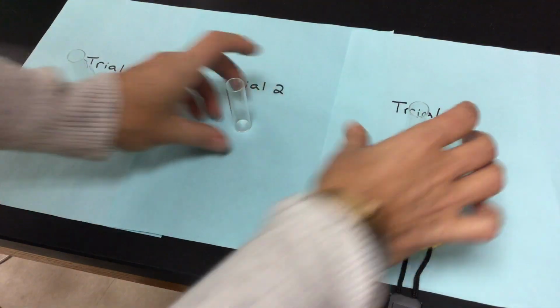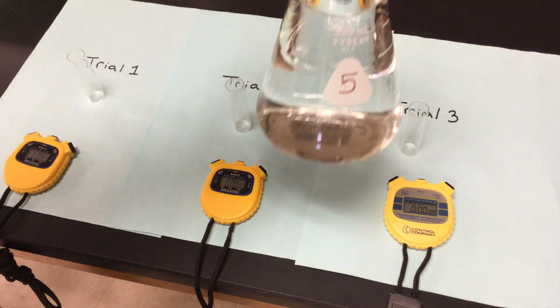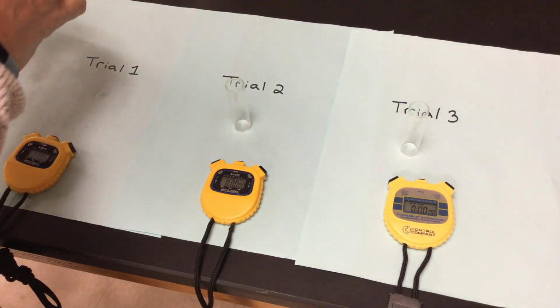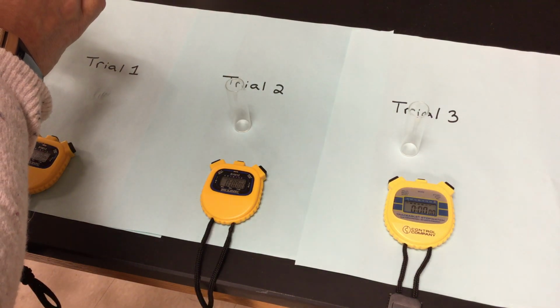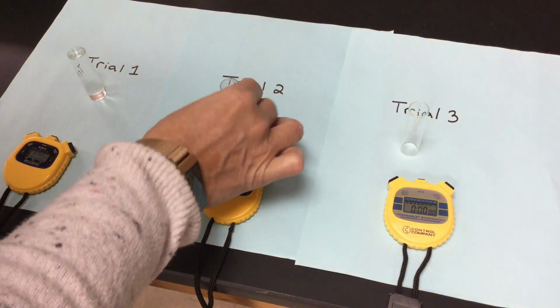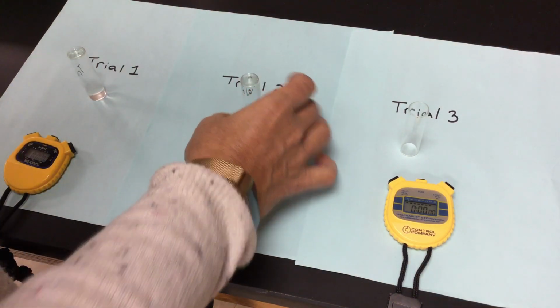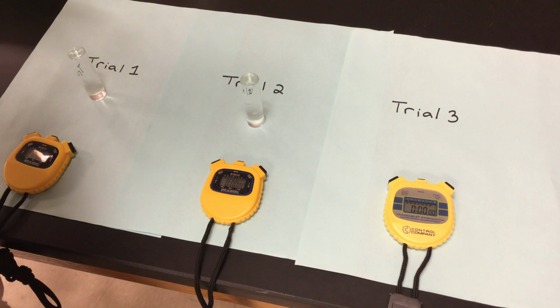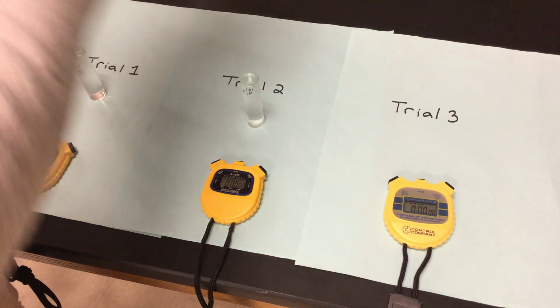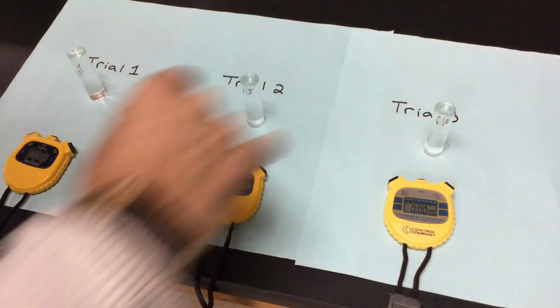I've got my tubes here, timers are here. We are moving on to a pH of 5. So now we are on a pH of 5. It is slightly acidic. I'm going to fill my little glass cuvette tubes up to the top. So that is a constant, same size tube, same type of solution, same amount of solution. My filter paper discs are constant. The only thing that's a variable within this particular experiment is the pH solution that it is in. So whether we are 3, 5, 7, 9, or 11, that would be my variable that you guys have there. So now I have a pH of 5 in each one of my tubes.